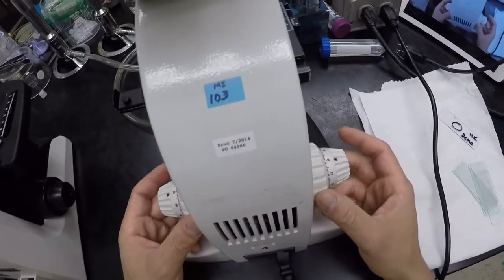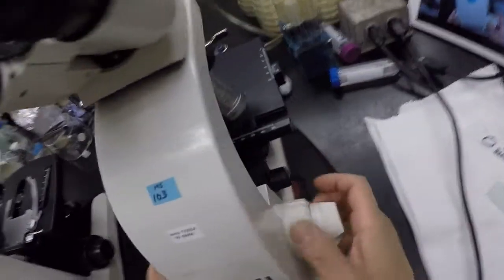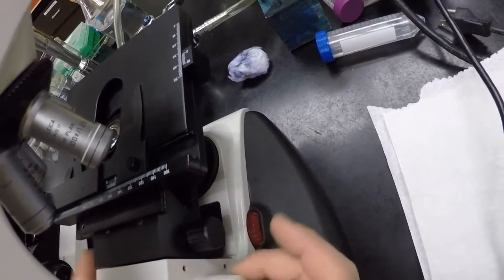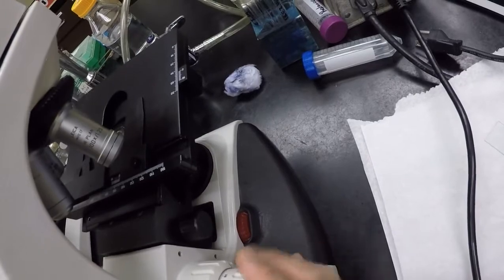Okay. These are focus knobs, right? And there are 2 focus knobs. The large one moves the stage. It's called a coarse focus adjustment. And notice when I turn it, our stage moves visibly up and down, so you can see it move quite fast. Our fine focus adjustment will move our stage quite slowly. So it does move the stage, but it's much harder to see the movement, right?